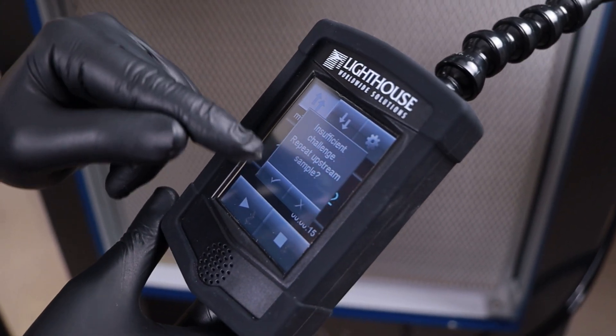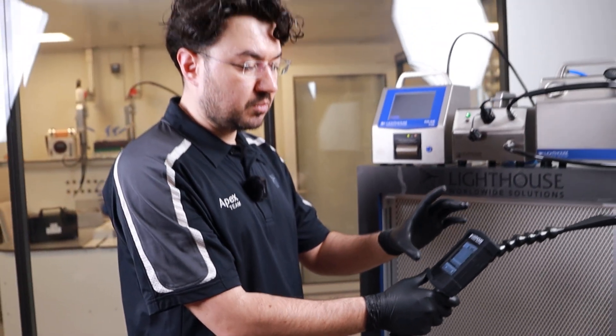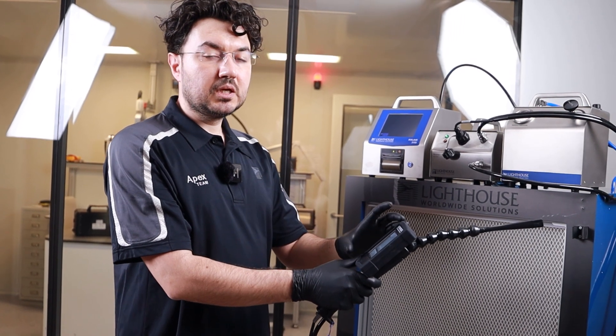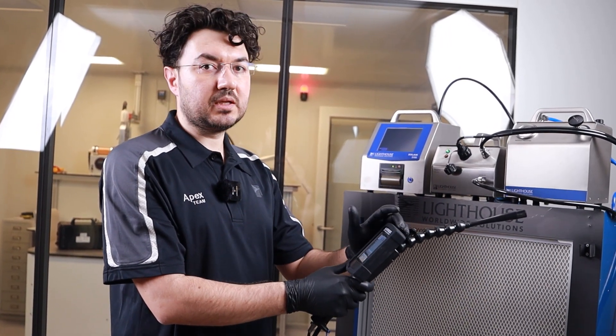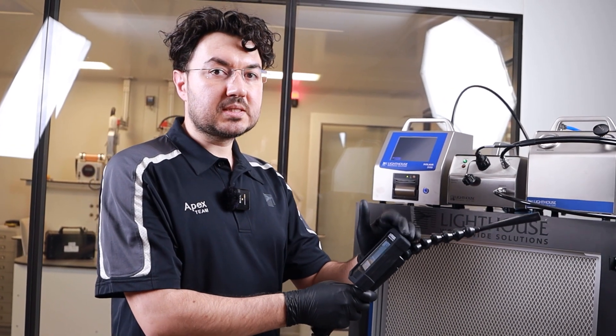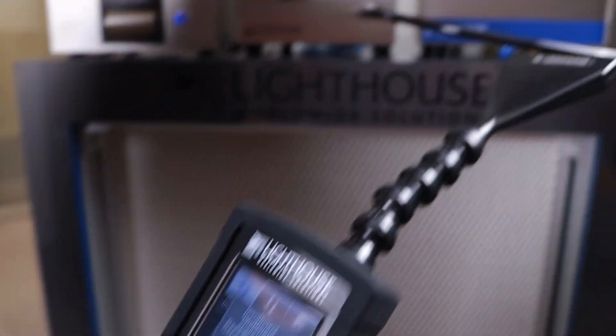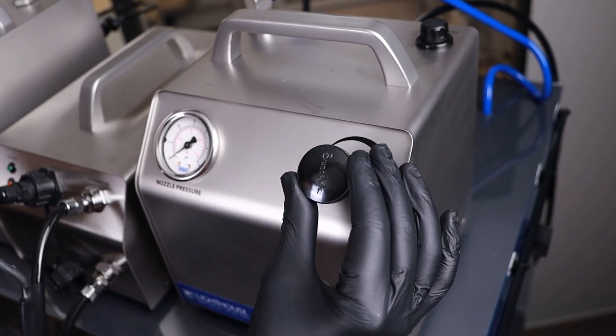The system has a smart feature which shows you that if the aerosol is not enough, then the system tells you insufficient challenge. Repeat upstream sample. So this is the important part for filter testing because most of the systems, if your challenge is insufficient, you may still start scanning your filter. But thanks to ScanAir Pro system, this gives you the feedback of insufficient challenge. Now I need to increase my challenge a little bit. I will retest it.